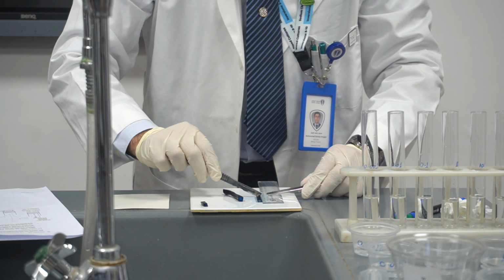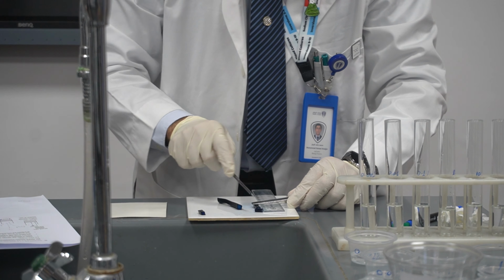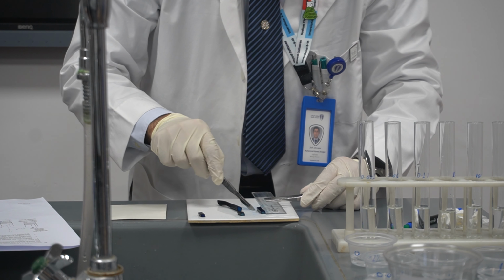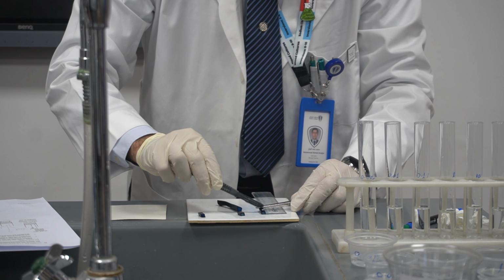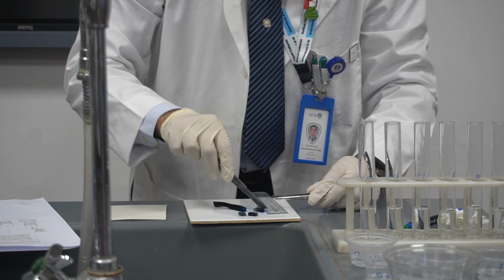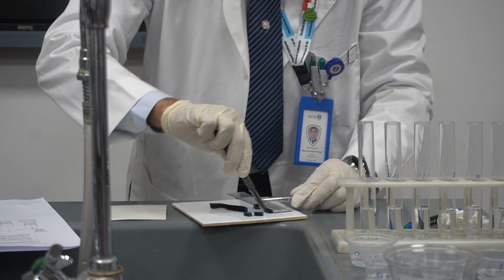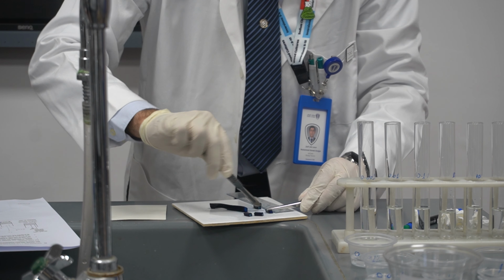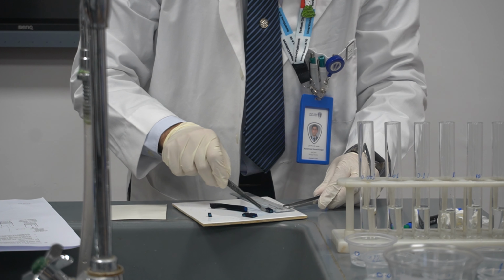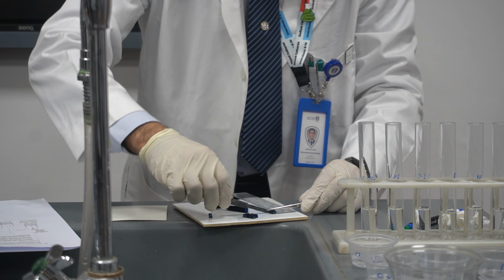Then another, second, I think, third. Yeah, I need to do this one more time. I have to be sure. Yes. So now I have 3 pieces, equally cut to a length of exactly 1 centimeter. Now I have 3.